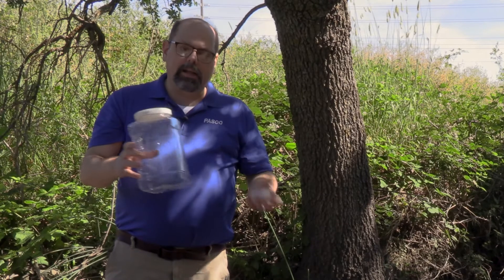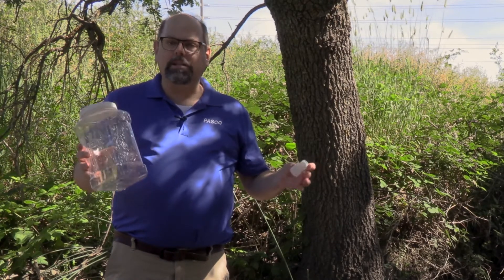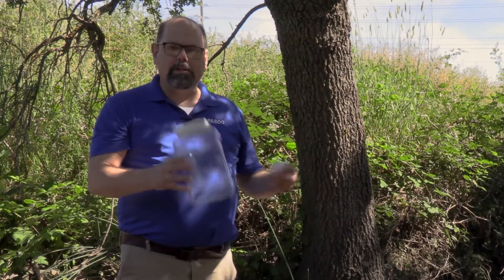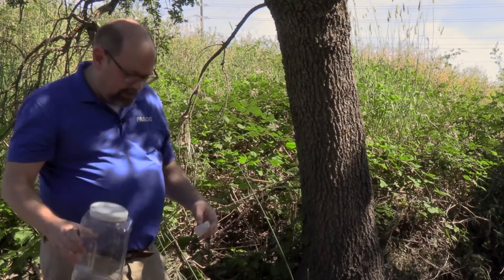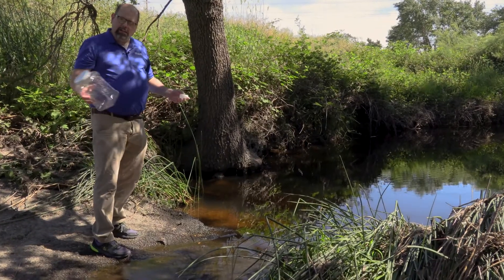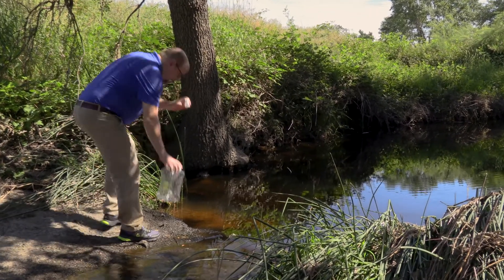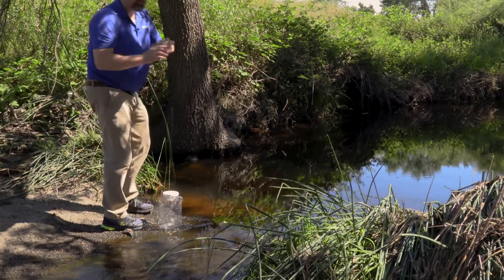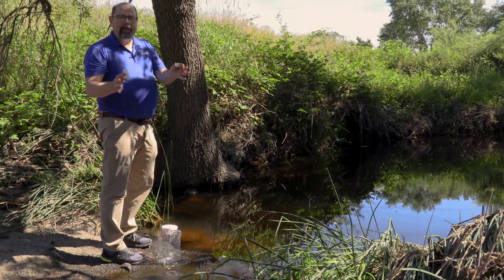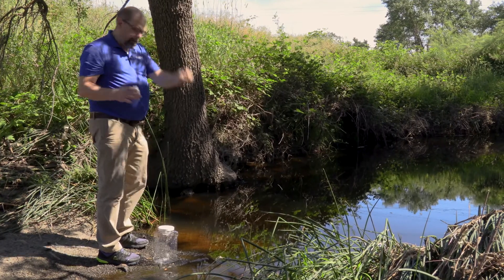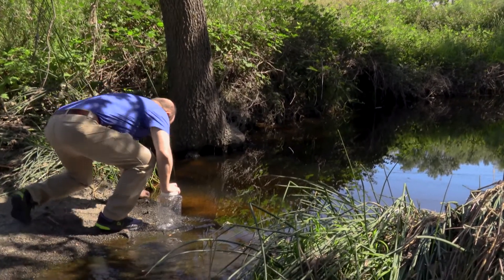If you're going to take samples from someplace that's a little farther away, I'd suggest putting them into a cooler with ice so that they slow down the biological activity, that way you can use them with class the next day. We're going to take a small sample and show you that process. You're going to first take the cap off, rinse it a couple of times, fill it, and then cap it underneath the water a couple of inches.